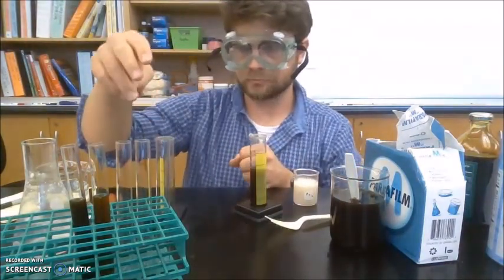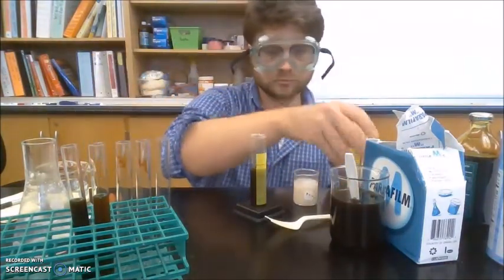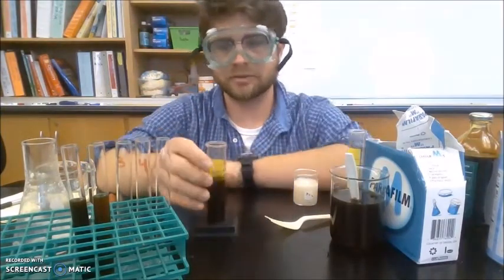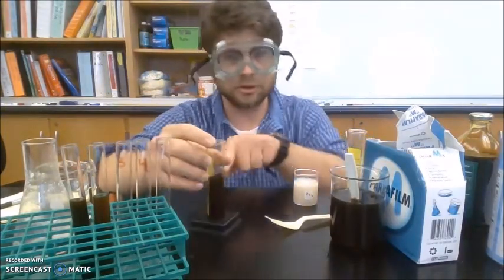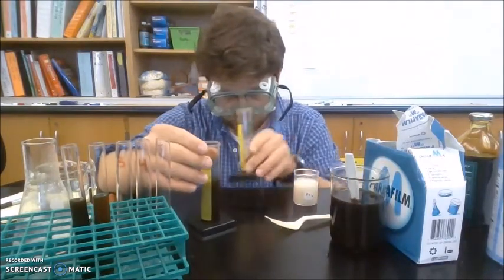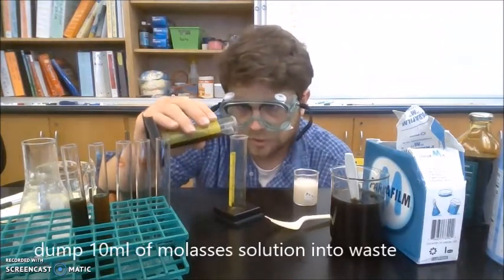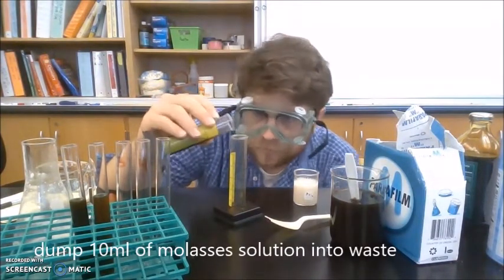Okay. So now with the remaining amount, I want to dump. I want 25 left in here. So I have 35. I need to dump 10 out. So I'll just dump here.